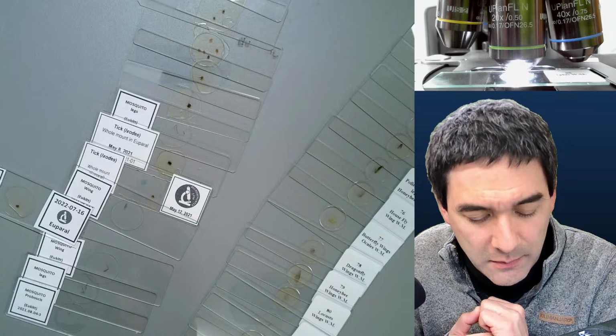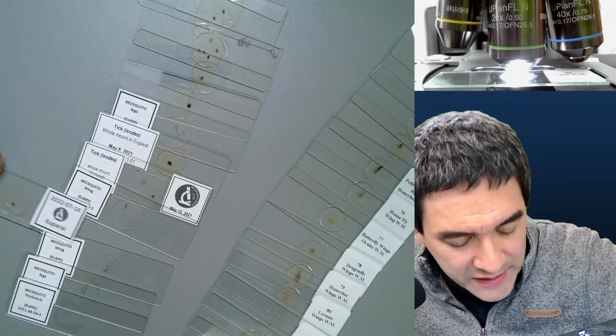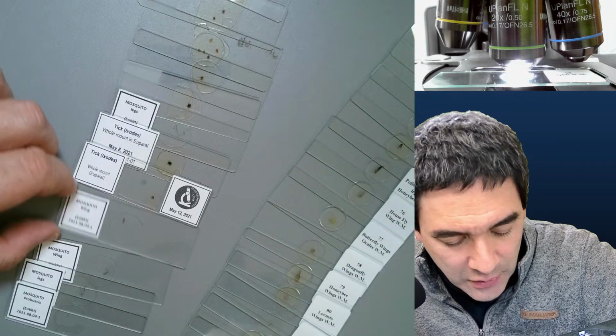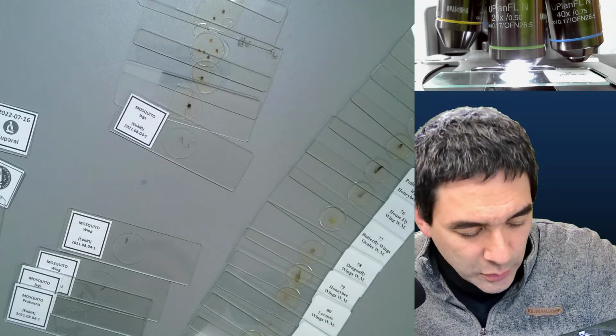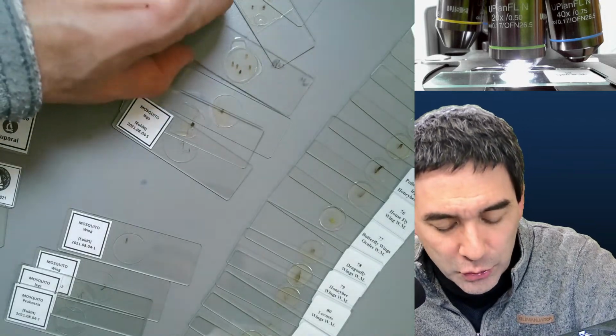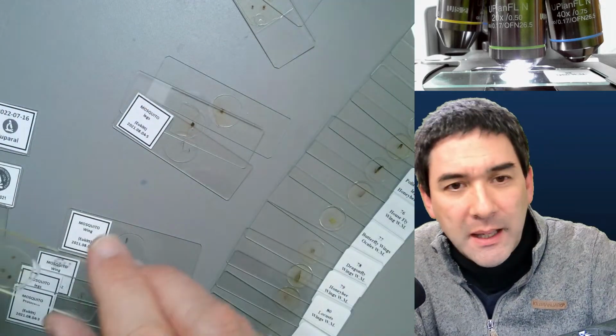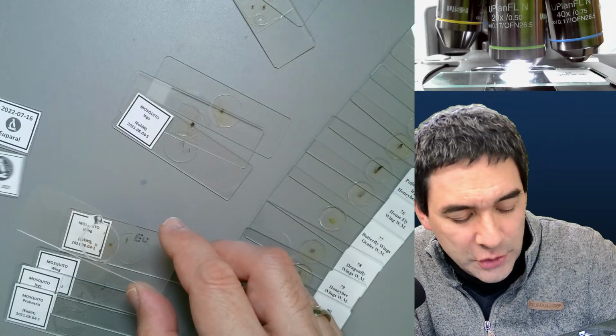Okay, but maybe we're not going to talk about the insects first. I want to get the non-insects out of the way first, which are the ticks. I do have a couple of tick slides here as well that I would like to show you. Okay, and some mites, simply to show you a little bit, because the mites and the ticks are indeed related. Simply for the sake of completion, because I made those.